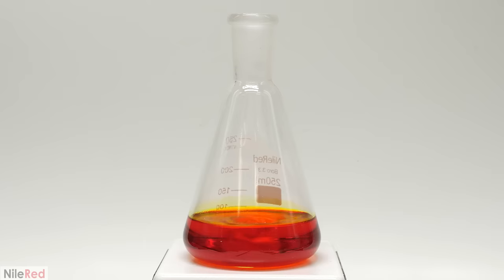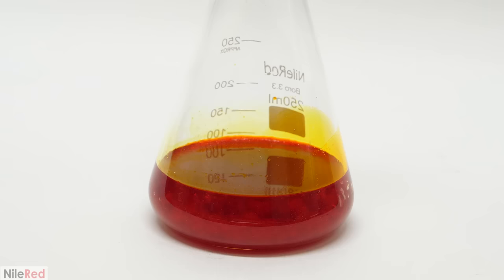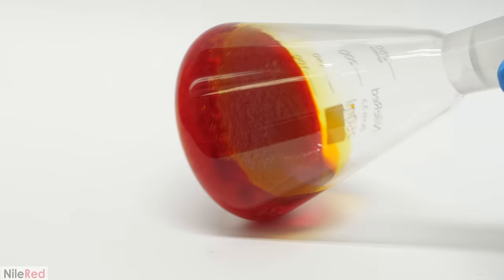At this point I sealed it with a stopper, took it off the stir plate and I let it sit somewhere dark for about 24 hours. During this time the reaction slowly went to completion and when I came back to it it had almost completely solidified.